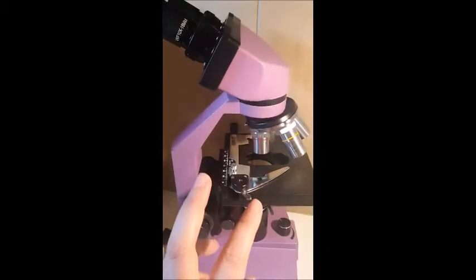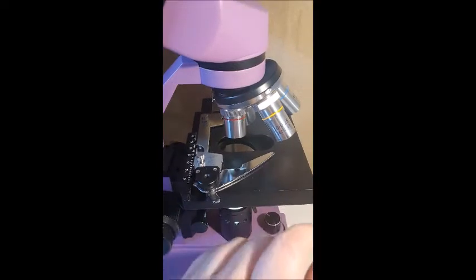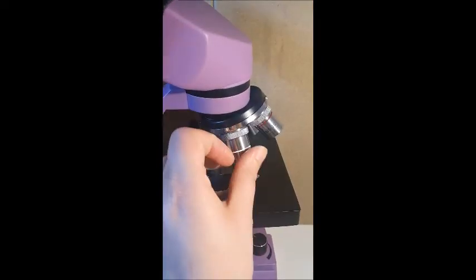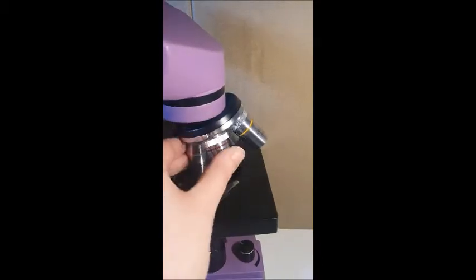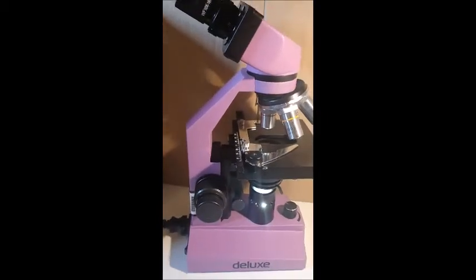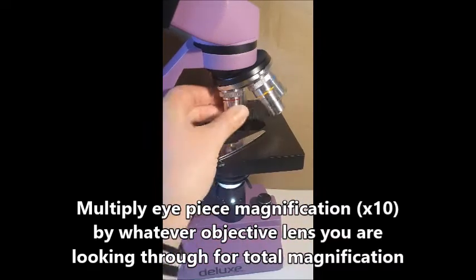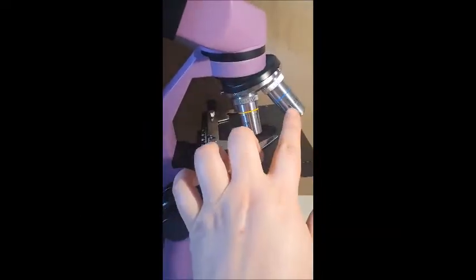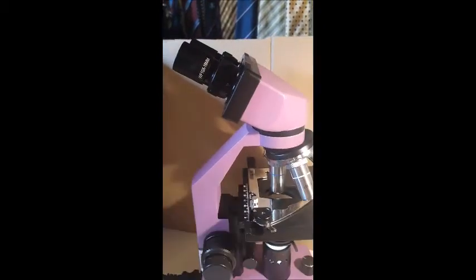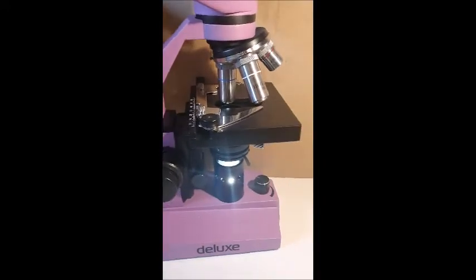So to figure out your total magnification, you times 10 by whatever magnification you're looking at here. So if we're using this one with 4, that's the smallest magnification, times 10 is 40. So when you're looking through that one, what you're looking at is 40 times its original size. If you were going to look through this one, which is 40 times, and then you've got the eyepiece, which is 10 times, 10 times 40 is 400 times. So whatever you're looking at is 400 times its original size.